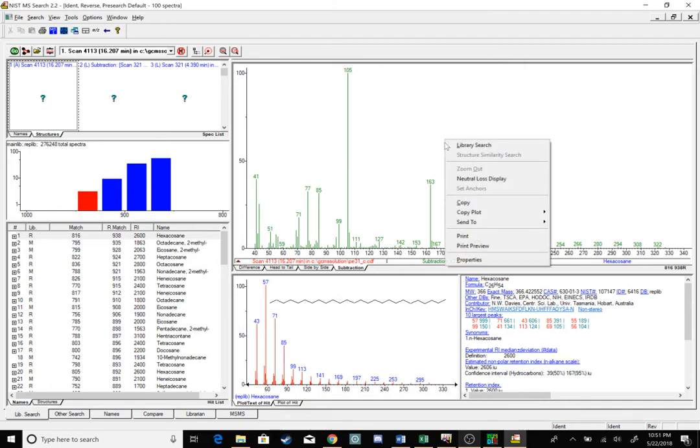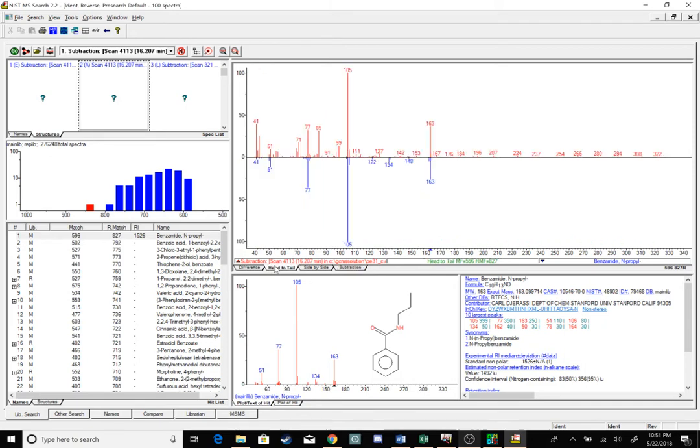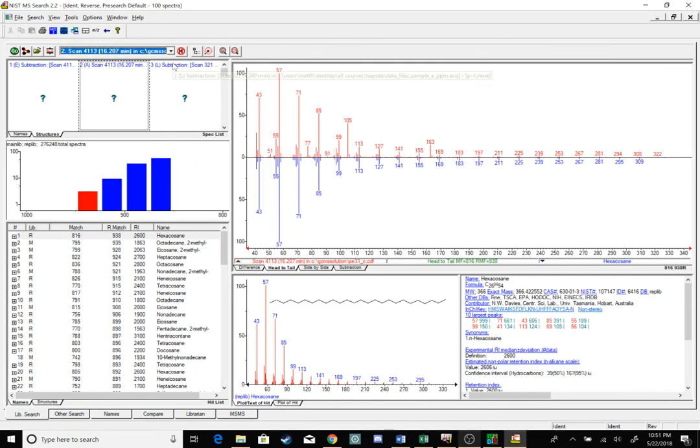I can right-click on this pane and do a library search, and voila, N-propylbenzamide with a fairly low SI at about 600 over here. It's not ideal, but I can click my head to tail, and I can see, okay, my 105, 105 matches, 163, 163 matches, 77, 77 matches. I have a little bit too much 85 over here, but if I undo what I just did, go back one, that 85 may have just been in a larger proportion than expected in my previous data file.